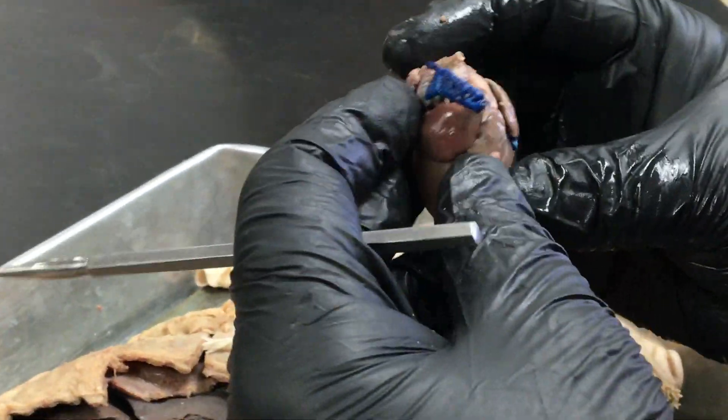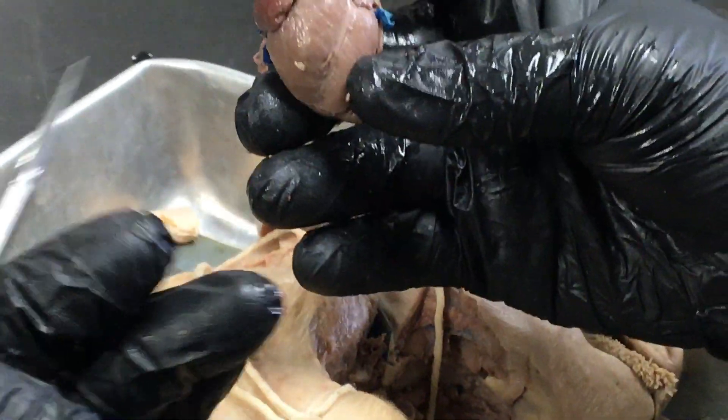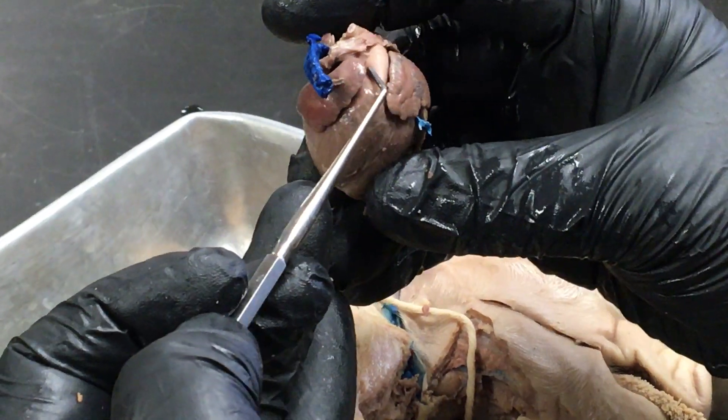Let's get to the heart before we run out of time. This creepy thing sticking out the top is the latex that was in the anterior vena cava or pre-cava. Then we can see our post cava here, dangling down. Usually across the front of the heart you're supposed to be able to see coronary arteries and veins — I don't see it on this one, it didn't take the stain. There's our pulmonary trunk.